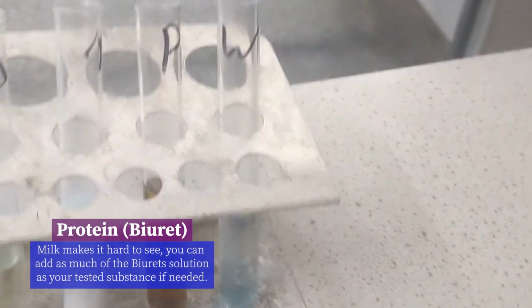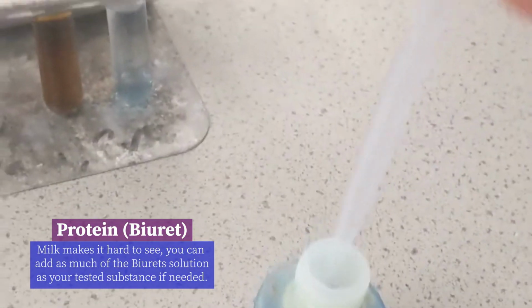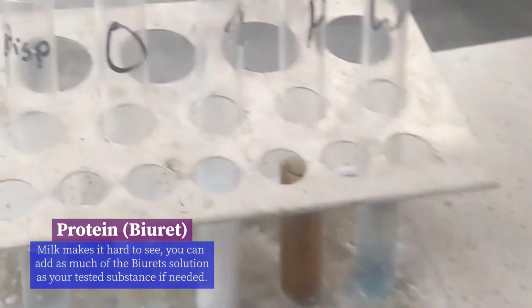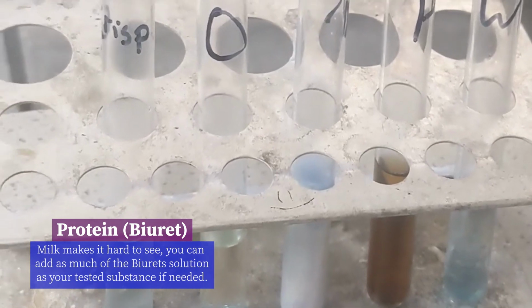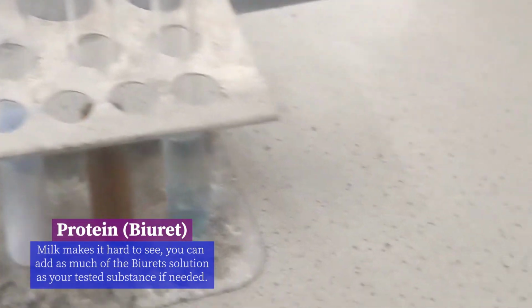If it turns a purple color, then that means that there's protein present. So purple, protein, some people might refer to it as a lilac color, right? But we're looking for that change of color, and that means that protein is present.